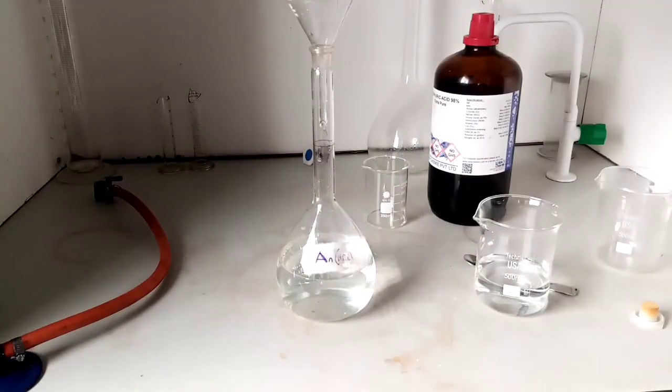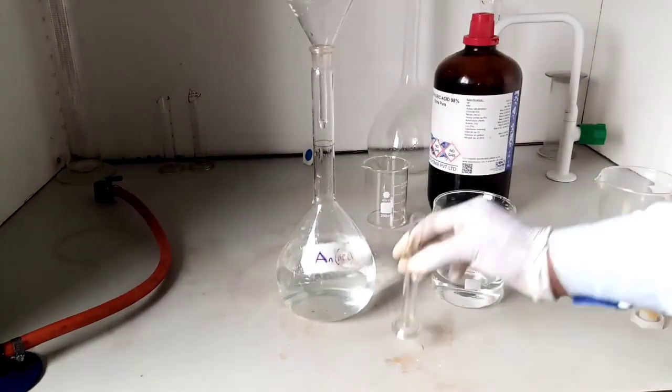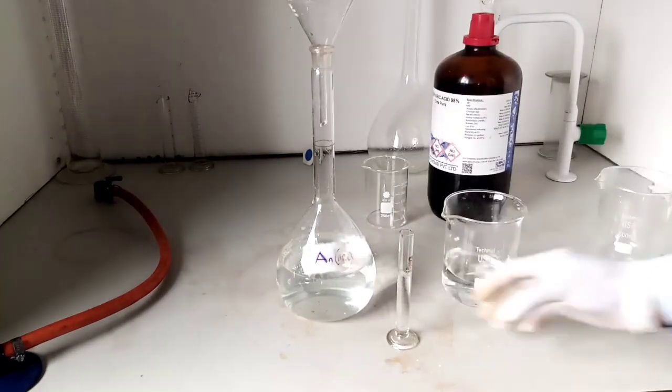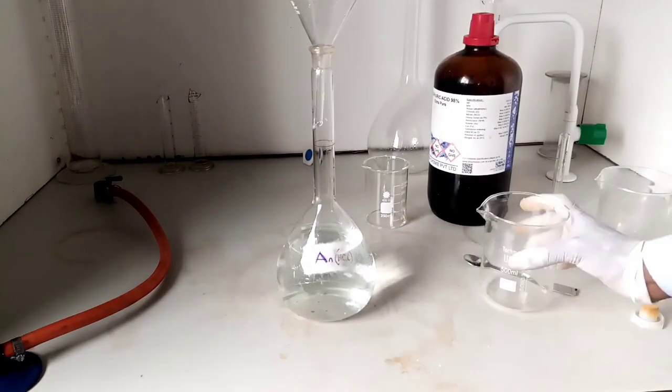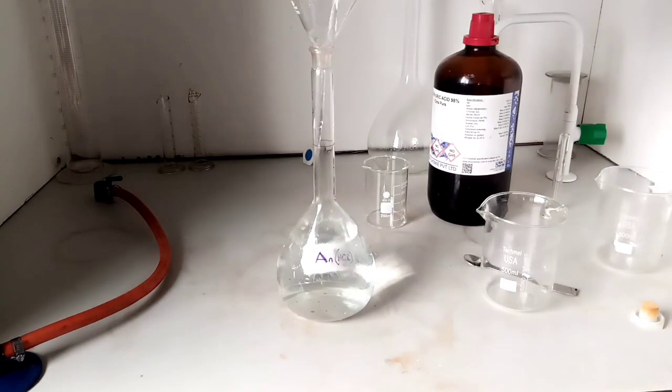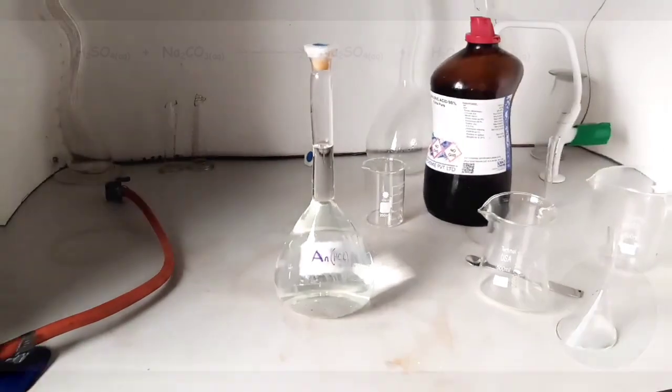Now you can add your acid to it, and then you dilute. You rinse a little from it first. You rinse it into it, and then you dilute to the 1 dm cube mark there. Alright, so here we go with our AN.